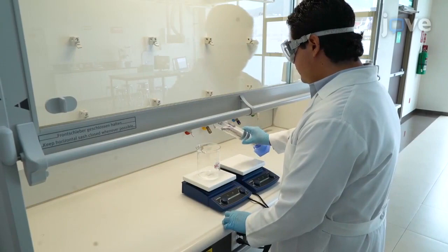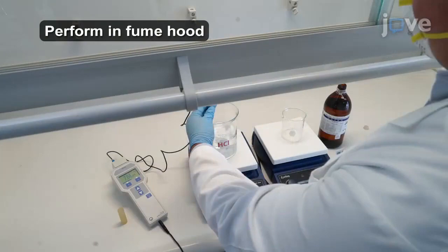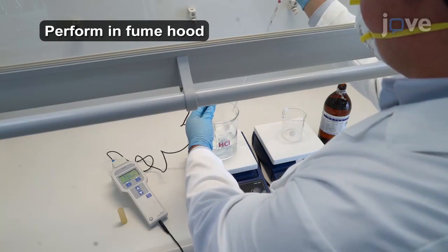First, pour 500 ml of deionized water into a 1-liter beaker with constant agitation. Then add 0.3 ml of 36.5% hydrochloric acid, making sure that the pH of the solution is as close as possible to 3.